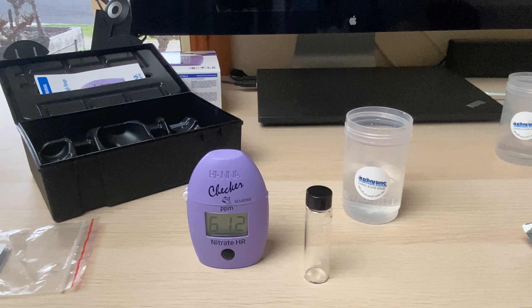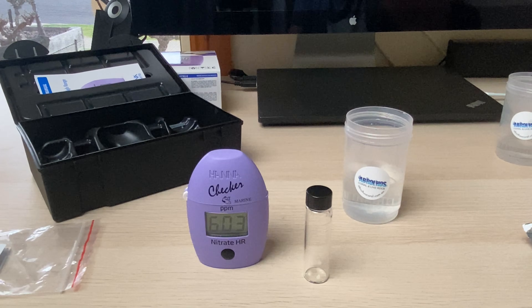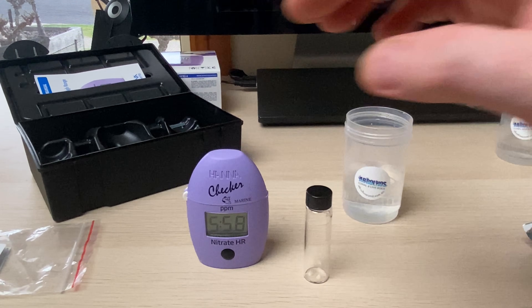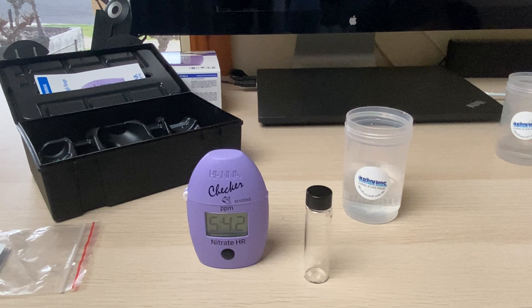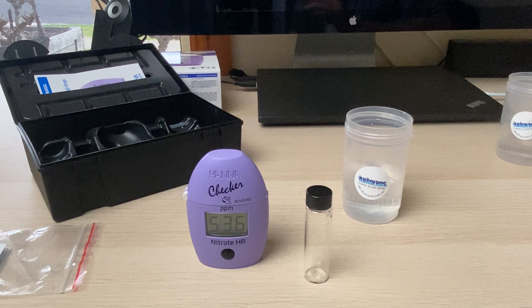I'm expecting it to be somewhere between zero and five. The nitrate low-range checker does up to five, and I'm all but certain my nitrate is below five — but I had a look at the instructions for that low-range test and it was intense, just too busy. This one, sure, it's only 0.1 resolution, but it's one reagent. A couple of minutes, you put some water and reagent in — just like the phosphate checker — and to me that's what a Hanna checker should be: something that quick and simple. So let's let it run its course and see what results it gives us.